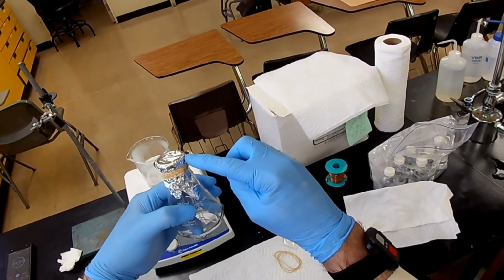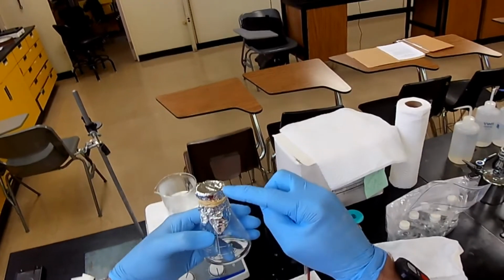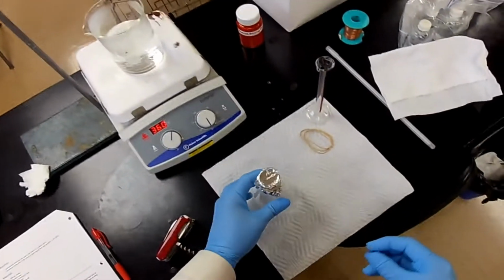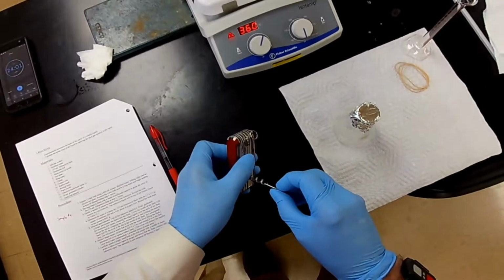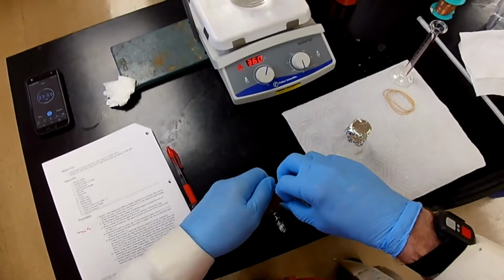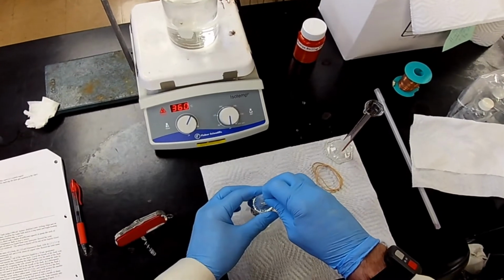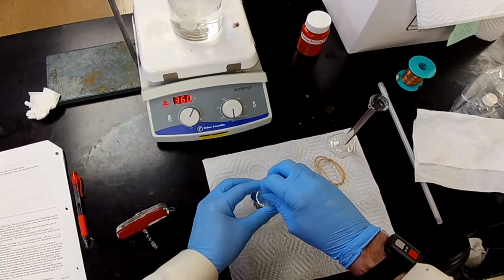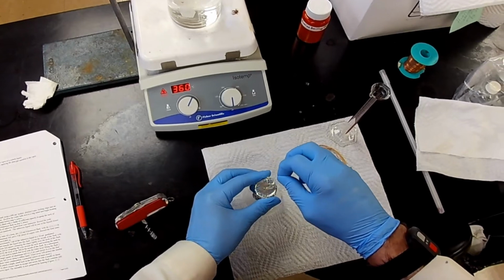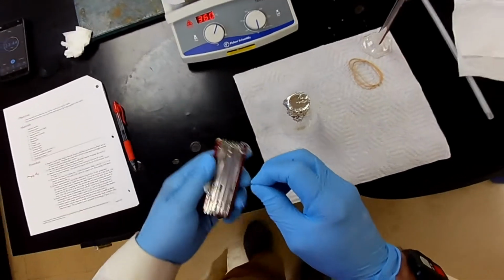And it has to be volume all the way to the top, not to the 125 milliliter mark, but all the way to the top. Right? So, no, I don't use that. I got a little pin here in my Swiss Army knife. And we're just going to poke a pinhole through both foils. Like that. That's plenty big.